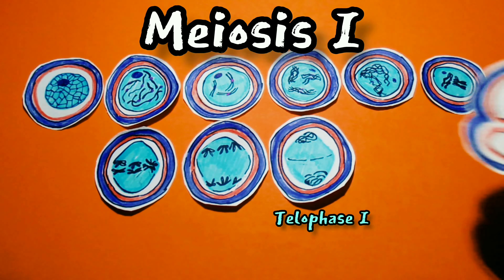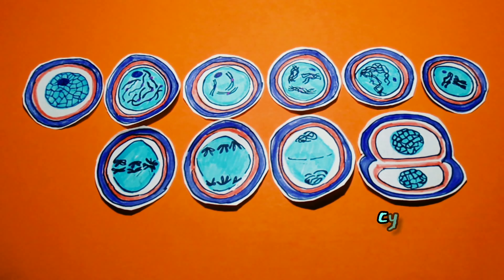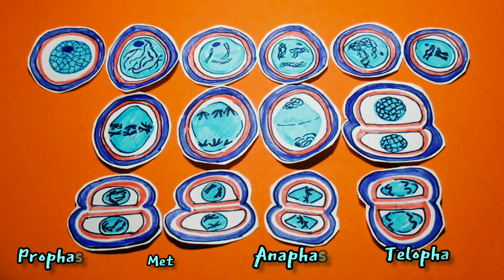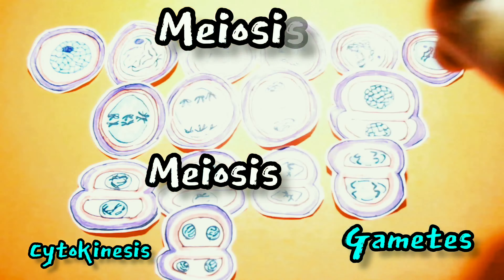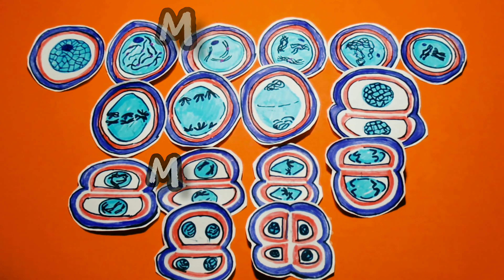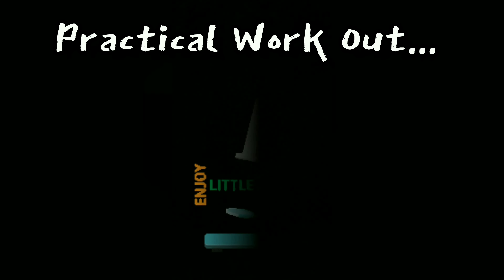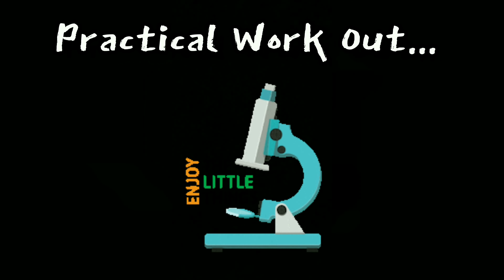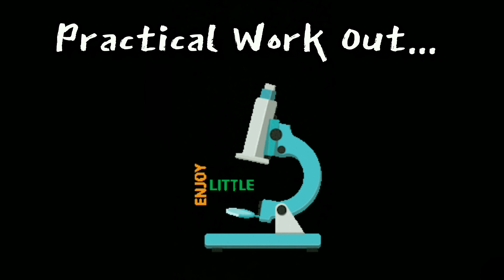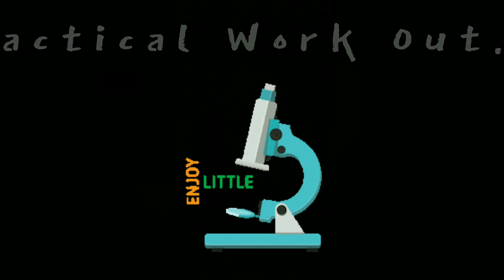The next division, meiosis two, consists of prophase two, metaphase two, anaphase two, telophase two, and cytokinesis. The final products are the gametes. Details of a few major stages of meiotic cell division are discussed with the help of microscopic images, and we will surely make another theoretical tutorial on this channel soon.